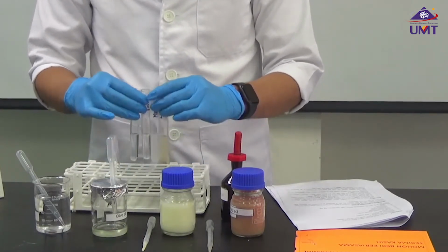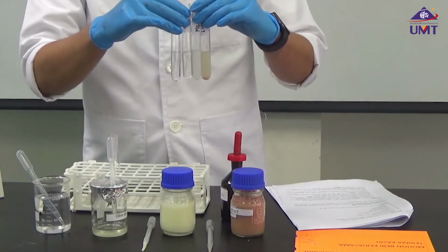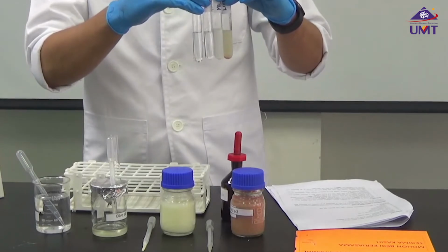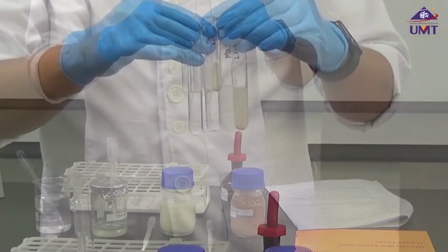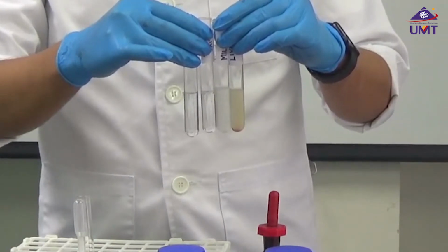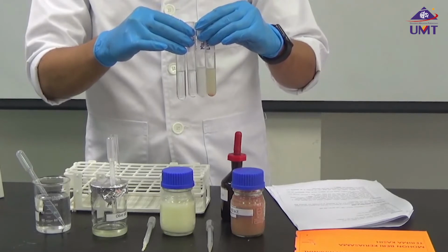For your first task, what did you observe based on my experiment? So record your findings.